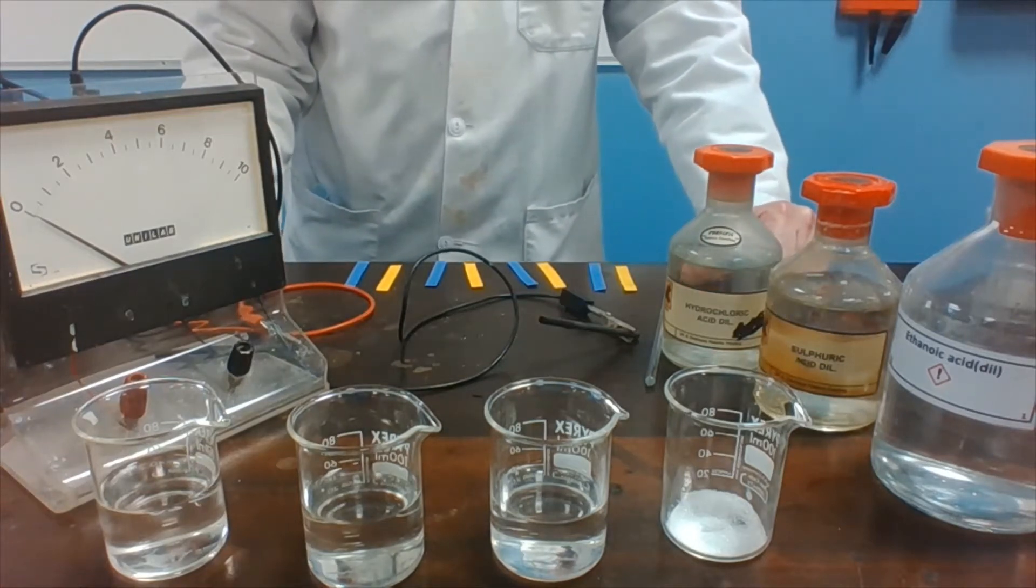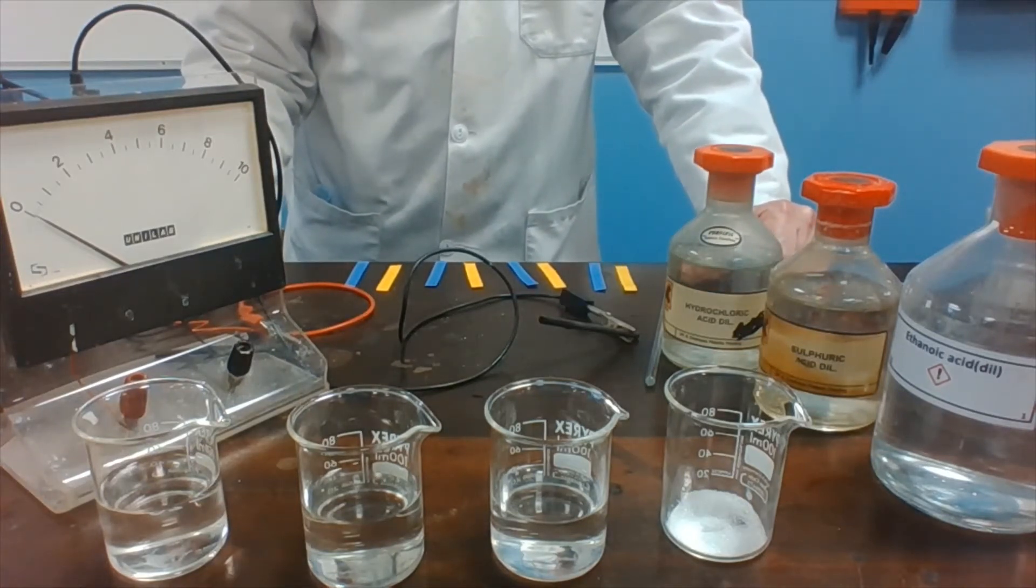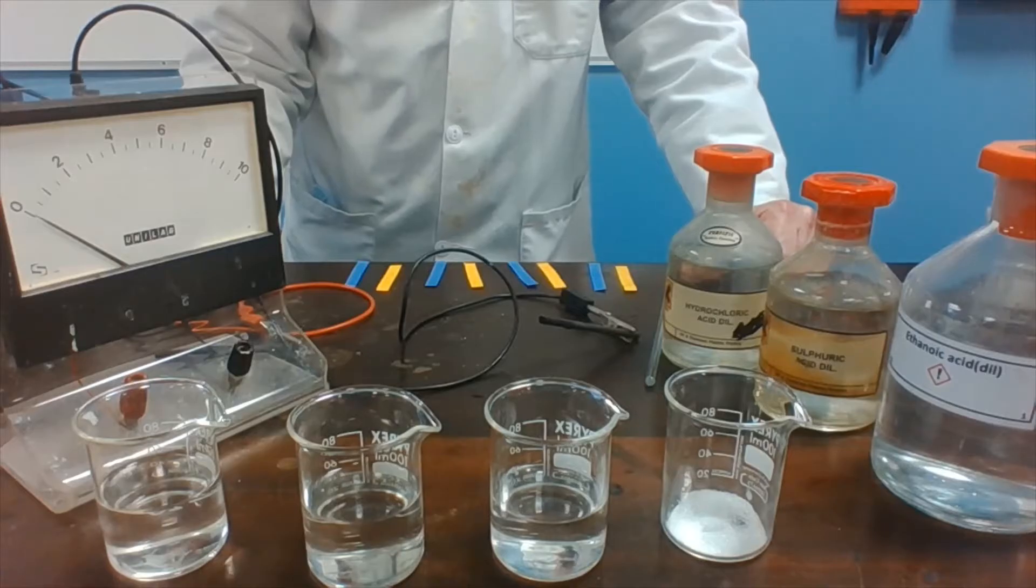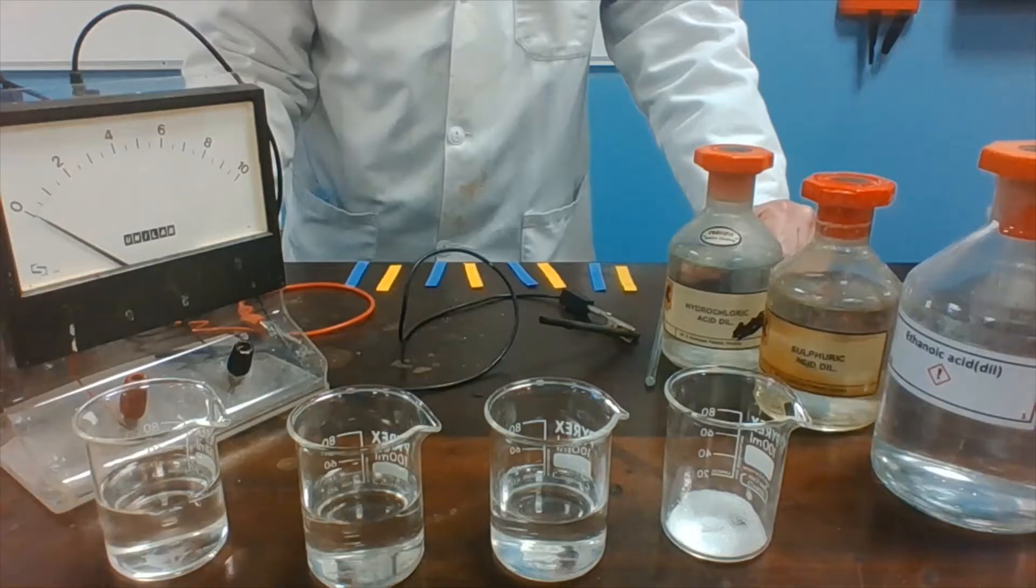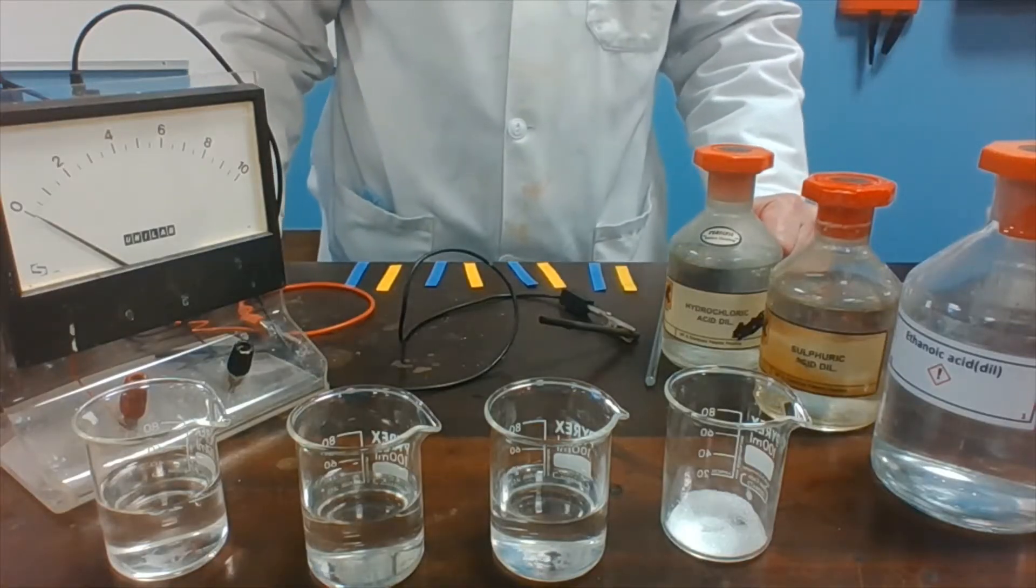This brief video is to demonstrate whether or not acids conduct electricity. First of all, let's show that we have got acids here.